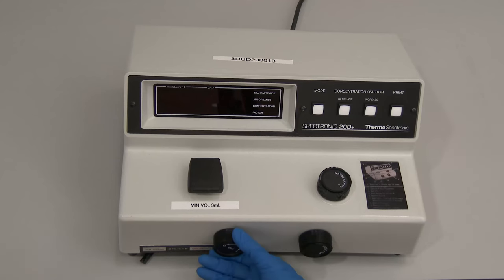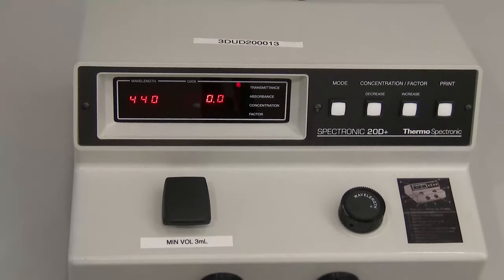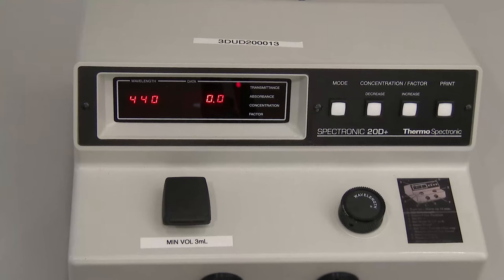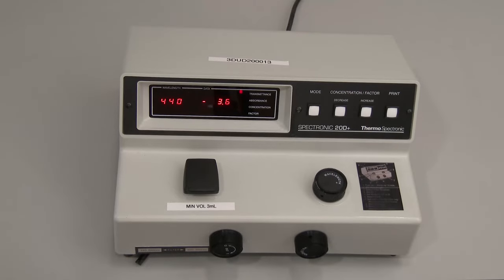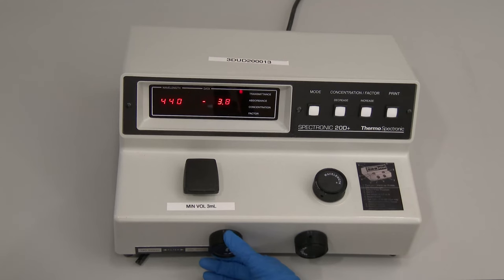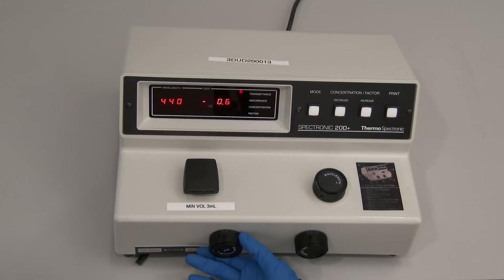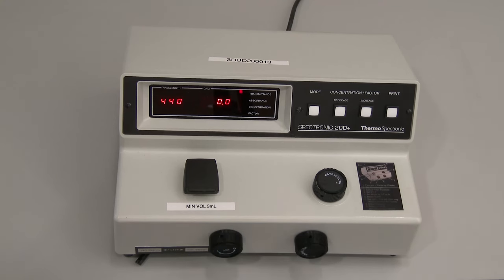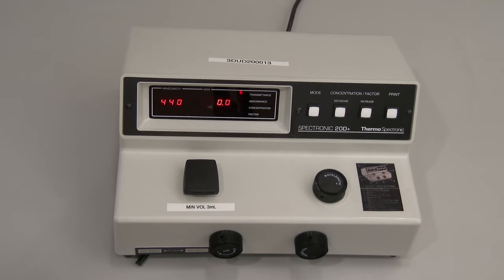The power switch zero control knob is used to power the instrument on and off and to set the digital display to 0% transmittance when the sample compartment is empty and the cover is closed. The transmittance absorbance control knob is used to set the digital display to 100% transmittance or 0.0 absorbance when a water blank or reagent blank is inserted in the sample compartment and the cover is closed.